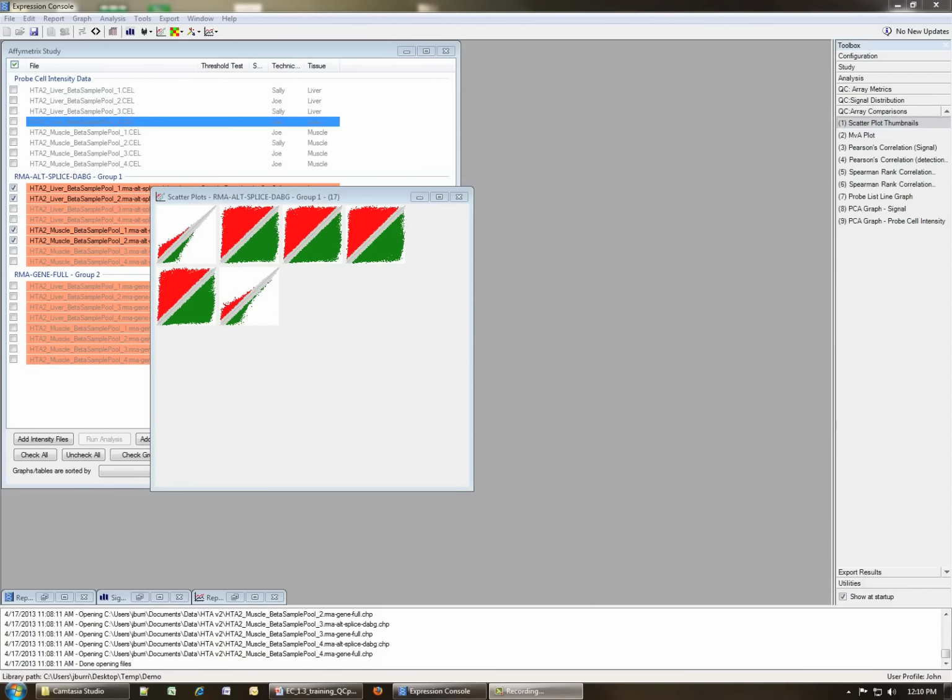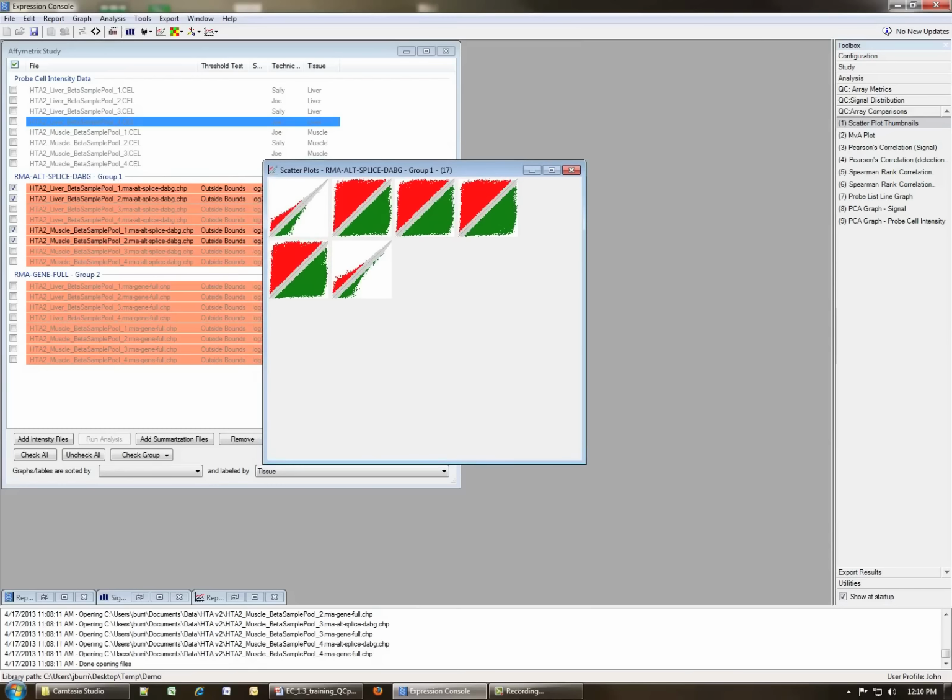Here are the display of the scatter plots, and you can see that they are red and green color coded. To mouse over to see which samples are being compared, you just put the mouse on it, and here you can see we have liver versus liver. Not surprisingly, we have not much change. Here we have liver versus muscle, liver versus muscle, liver versus muscle, and muscle versus muscle. So this is how you can look for sample swaps by not having the expected behavior in your scatter plots.